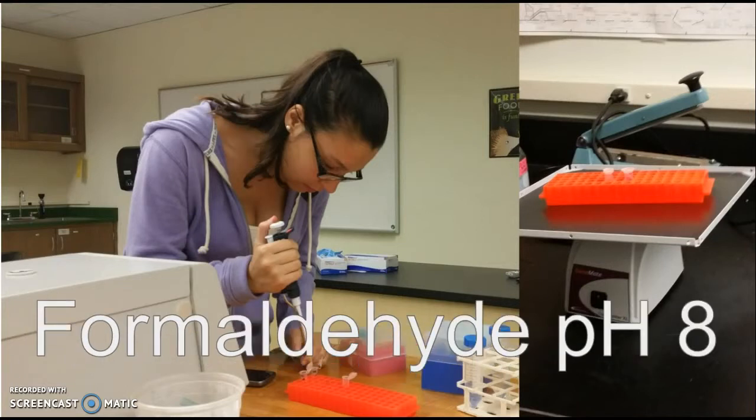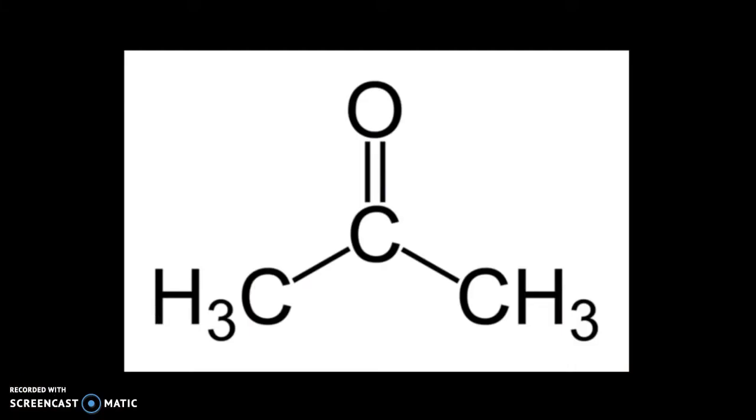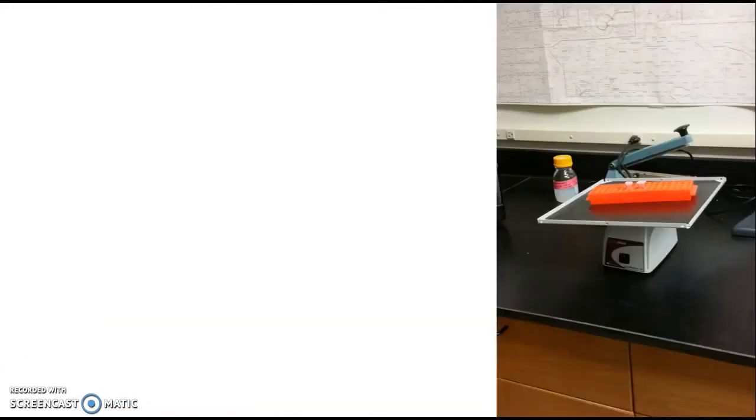We repeated this step using formaldehyde at pH 8 afterwards. Finally, we washed the worms with PBS buffer, centrifuged to make another pellet, removed the buffer, and repeated that step 5 times. Afterwards, we put in negative 20 degrees Celsius acetone and put the tube in the freezer, and came back a couple days later. When we came back, we once again washed the worms 5 more times. Then, we added 50 microliters of the phalloidin dye and incubated for an hour.